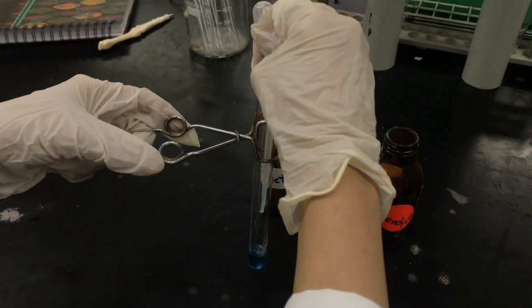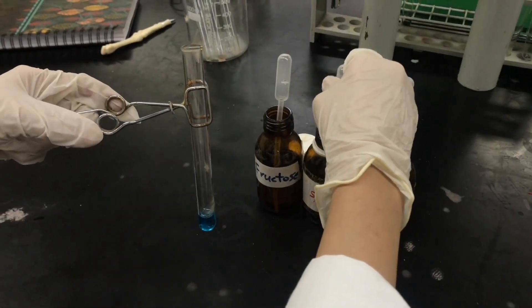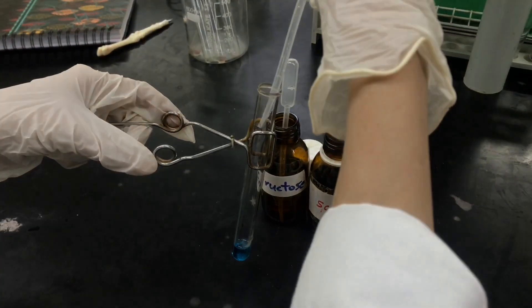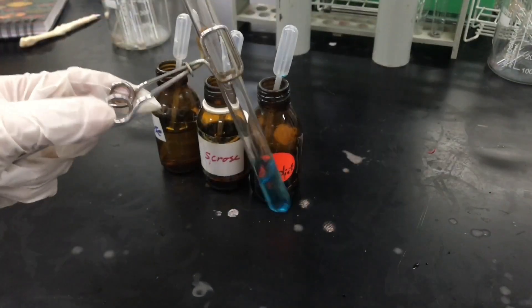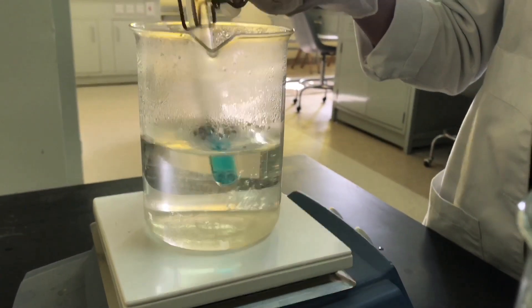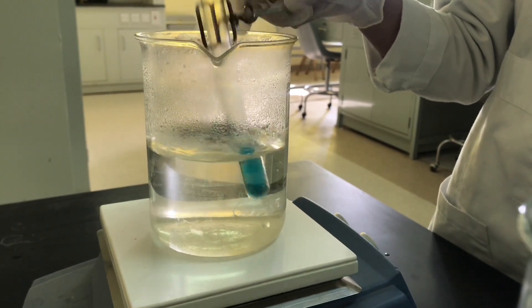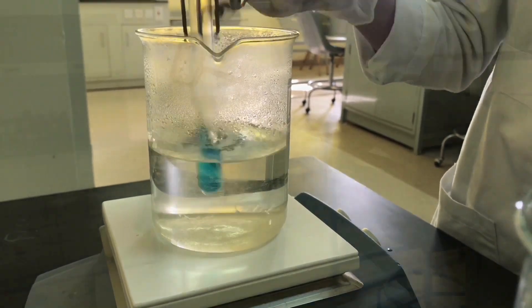Repeat the same steps but this time with a non-reducing sugar like sucrose. Add two mils of Benedict's reagent and five drops of sucrose. Shake well, then very carefully heat while shaking. Since you used a non-reducing sugar like sucrose, you're not going to observe any change in color.